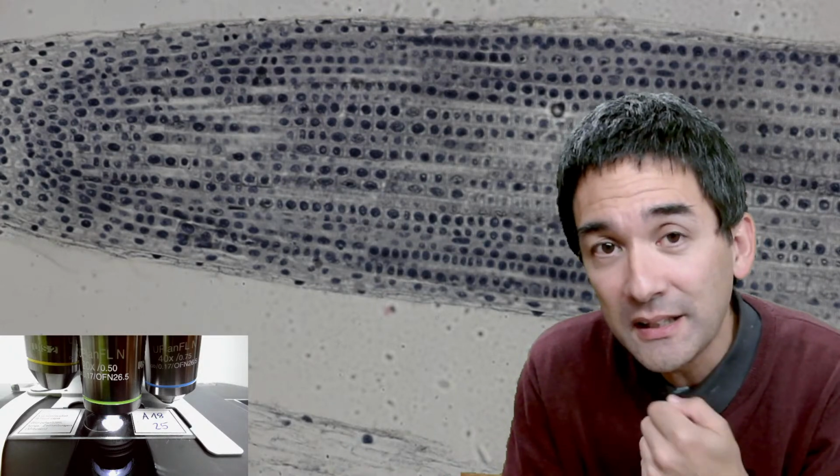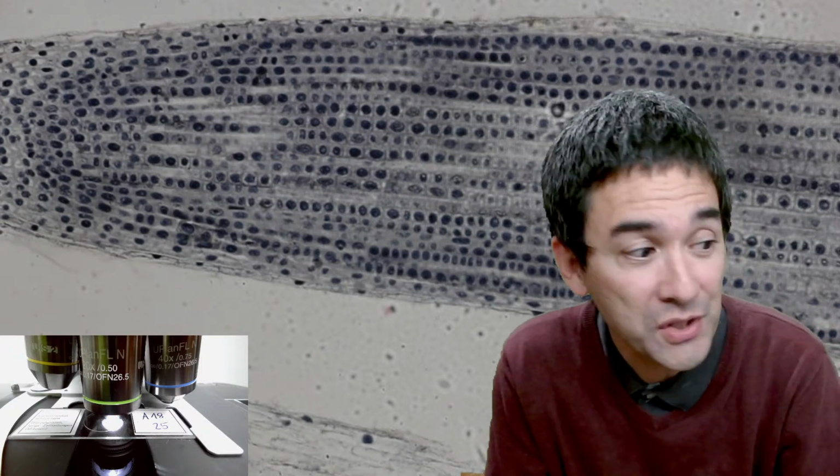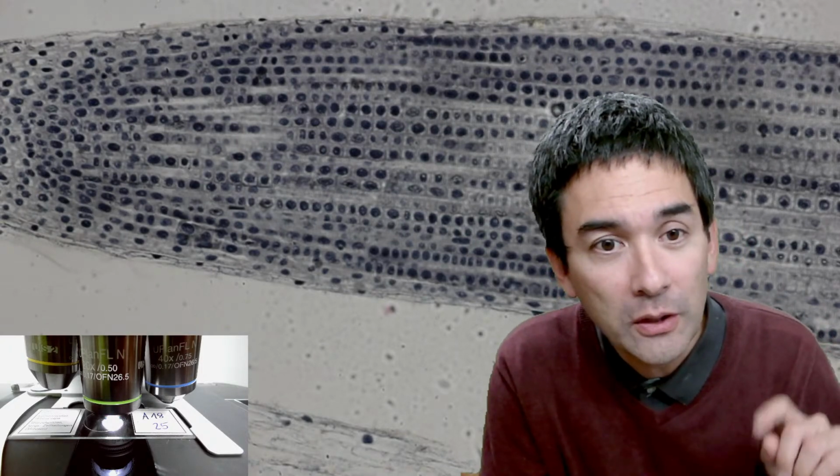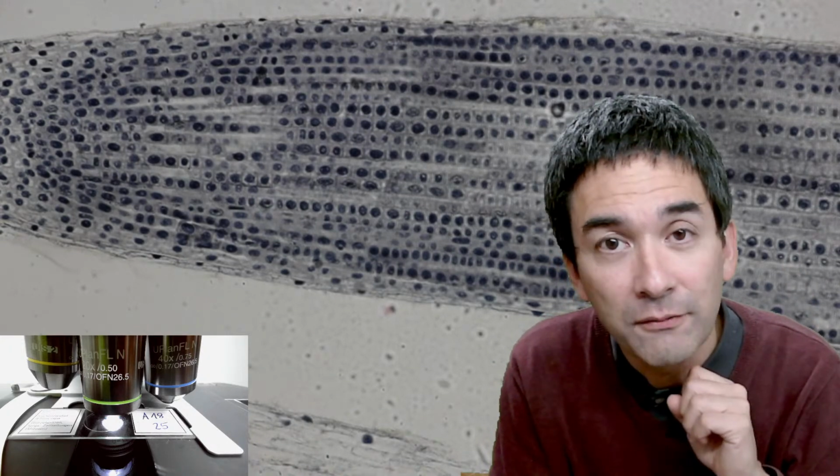And so for this reason, I decided that I'm just going to do a little video about the stages of mitosis and cell division, and we're going to look at the onion cells here in the back, and we're going to try to identify those stages.